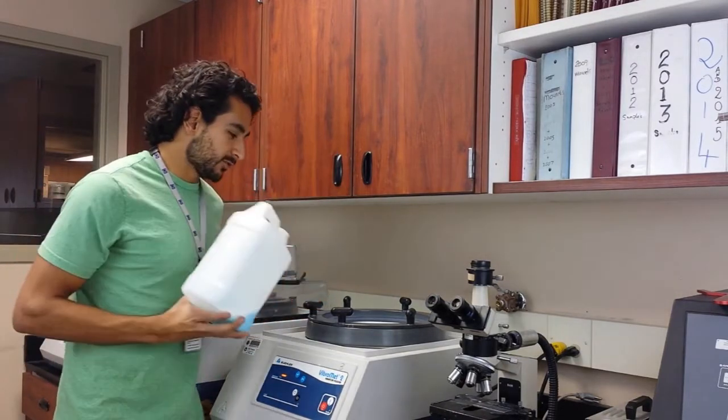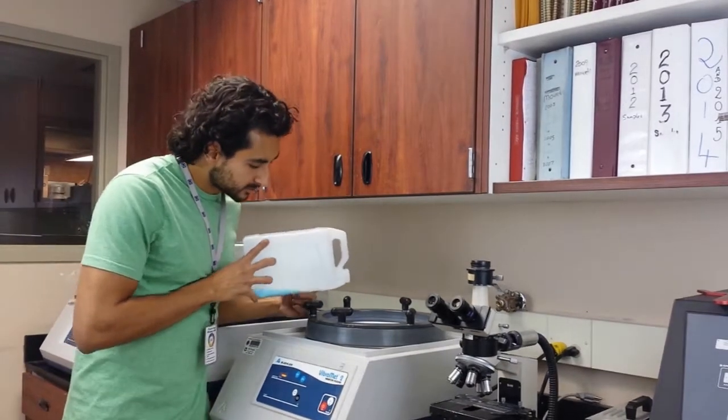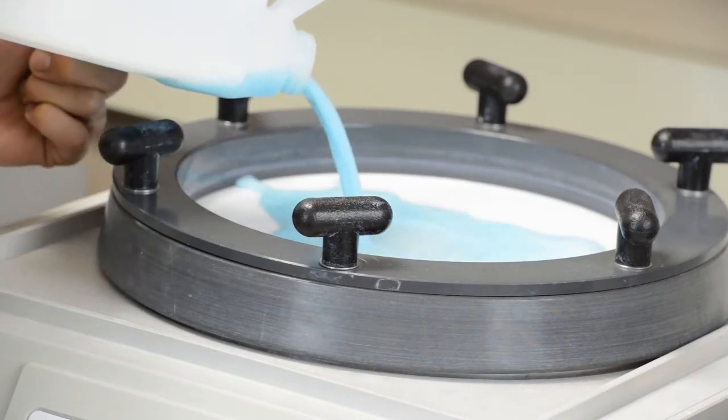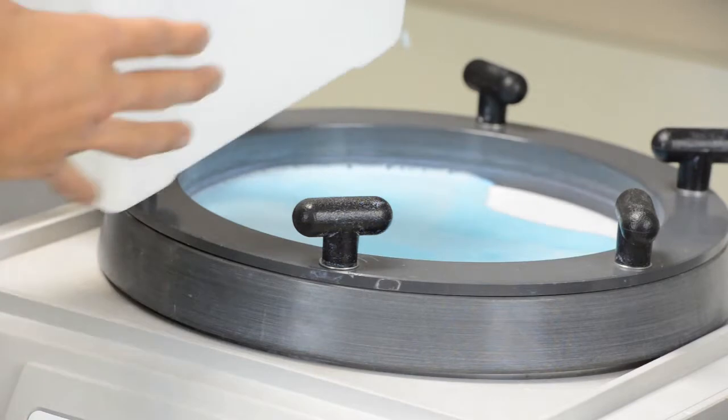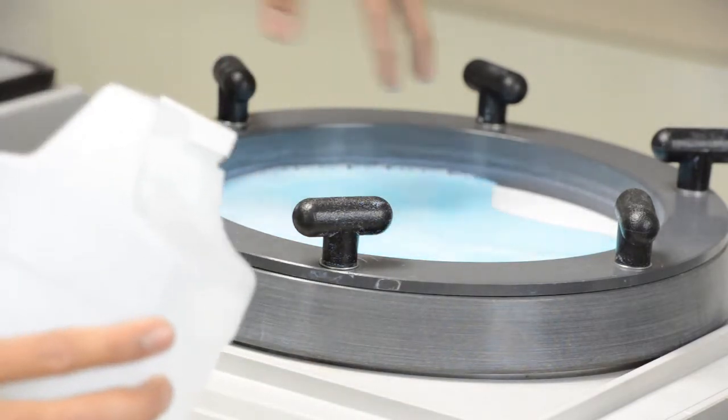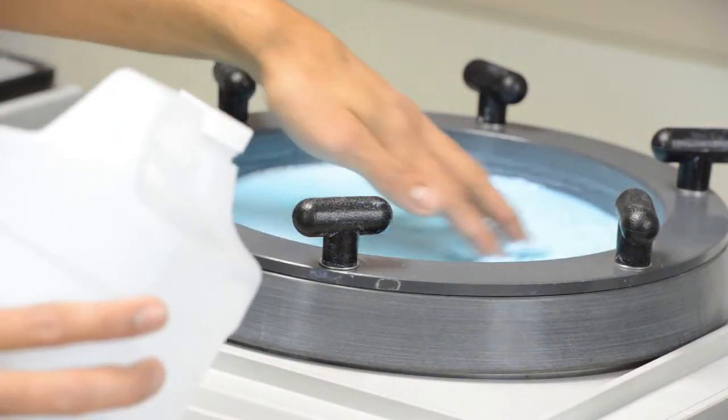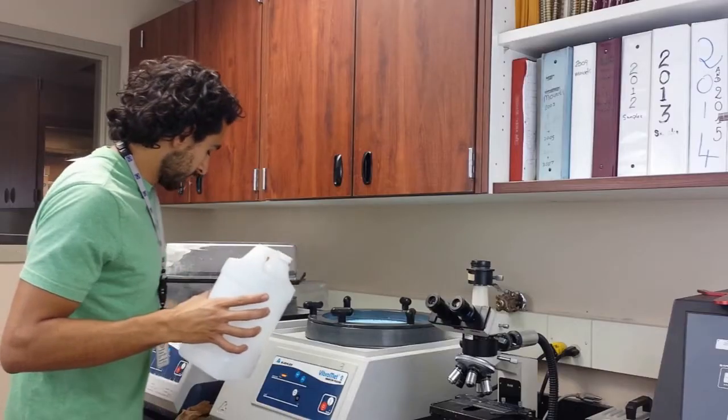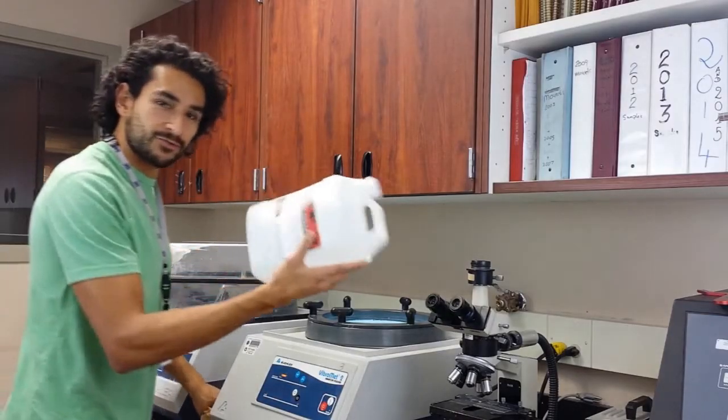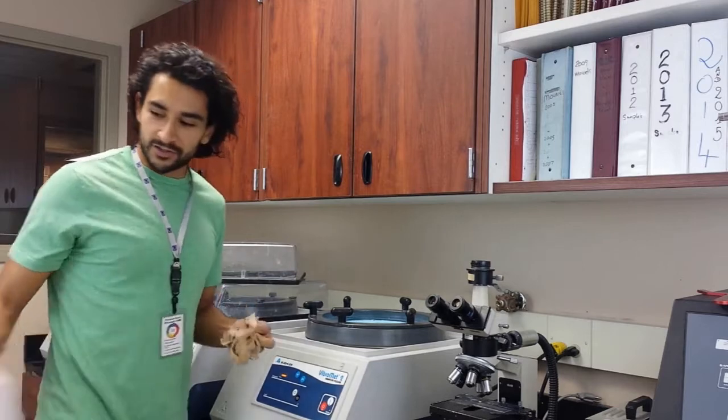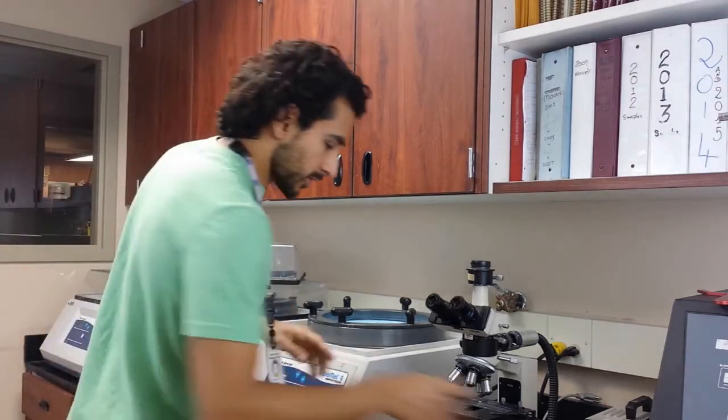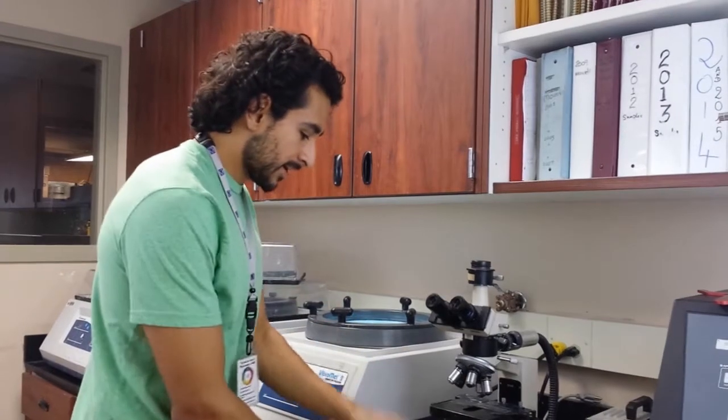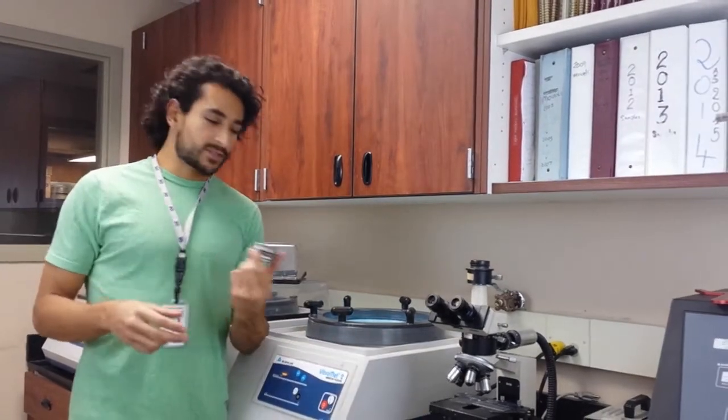So what you do is you simply pour it on the bowl until it covers the whole bottom of the bowl. This should be enough. I would have liked a little more if it liked, but I just ran out of it. But this is alright, it's just covering the bowl, the bottom of it.